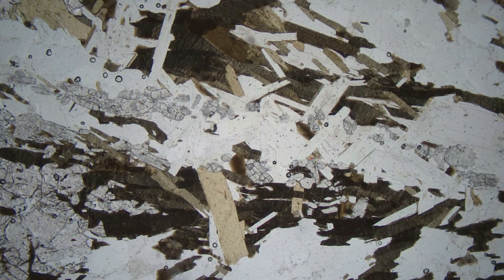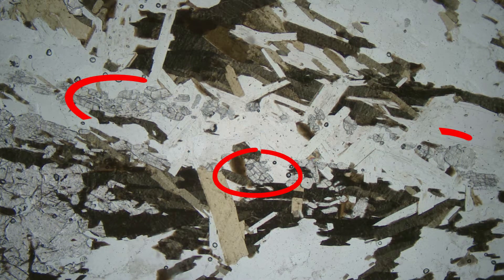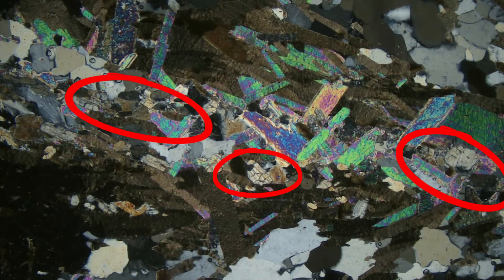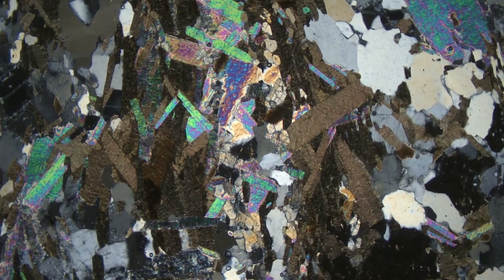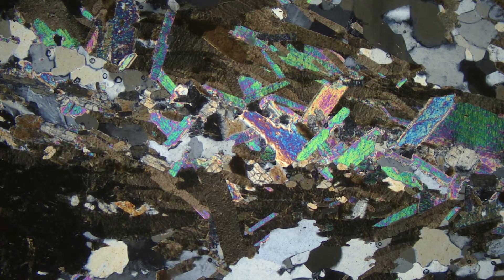If we switch back to plain polarized light, we can also see this sample contains kyanite. If we switch back and forth between cross-polars and plain polarized light, we see that kyanite's interference colors are never greater than first-order. As we rotate the stage, most of the color variation comes from the muscovite, but the biotite brown colors vary somewhat. And the quartz and feldspar change from white to gray to black.